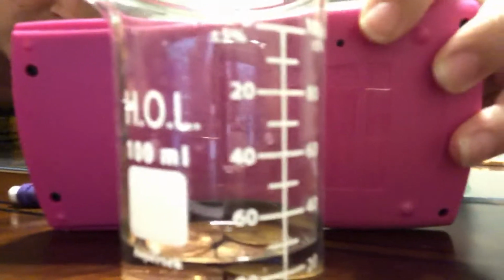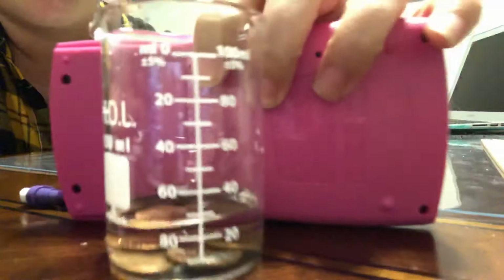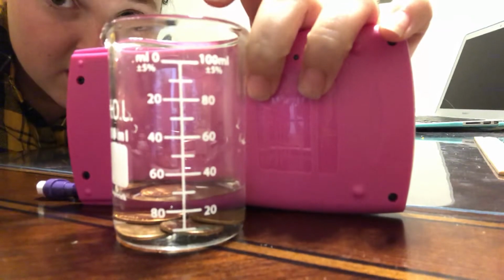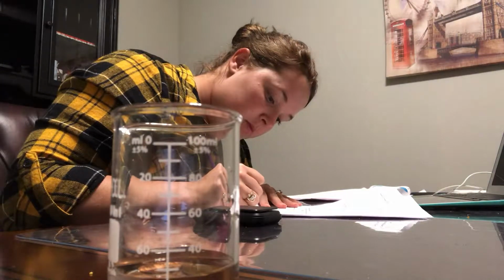And we can see that it really didn't move all that much. I'm kind of not on even ground here. Let's see if this helps, to see where the line is. So it's really close. It was at 25, and now I would say, let's see, with this back on there, it's probably at 26, honestly, because it didn't really move. So we're going to go with 26. So that would mean D1 is 26.